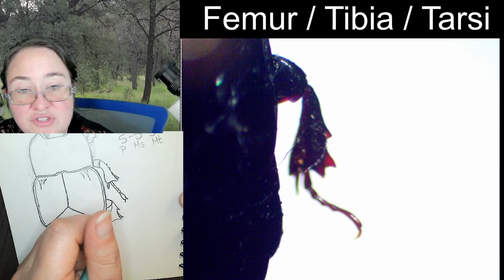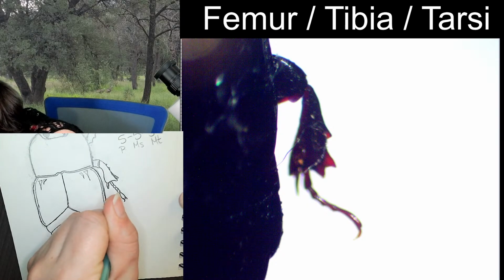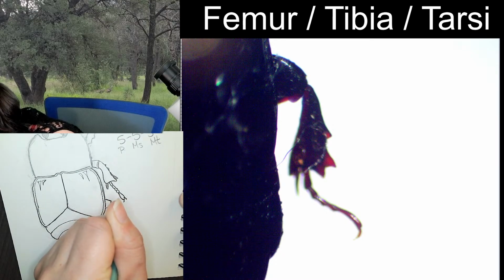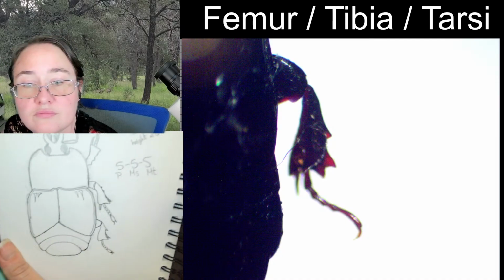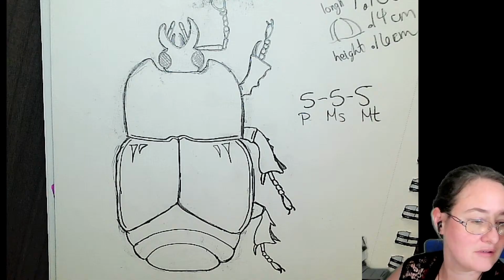And then tarsal segments. That is going to be the same as our middle leg. So that is 1 rectangle, 2, 3, and 4 are subtriangular, and then 5 is a raindrop. That's better.